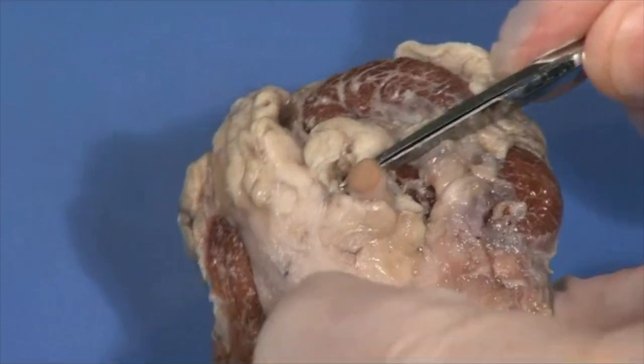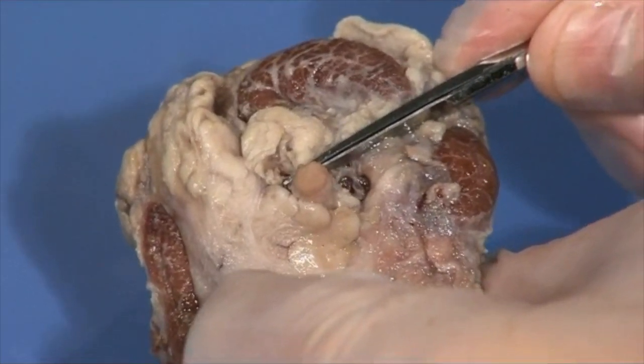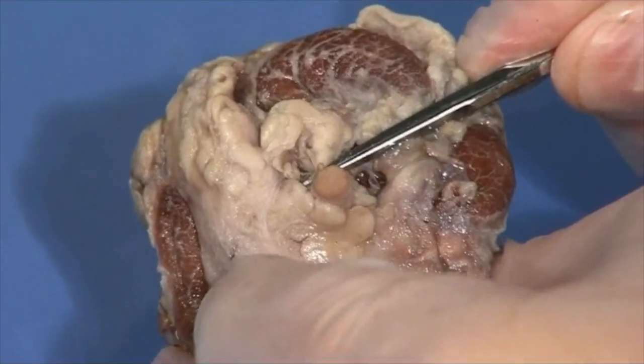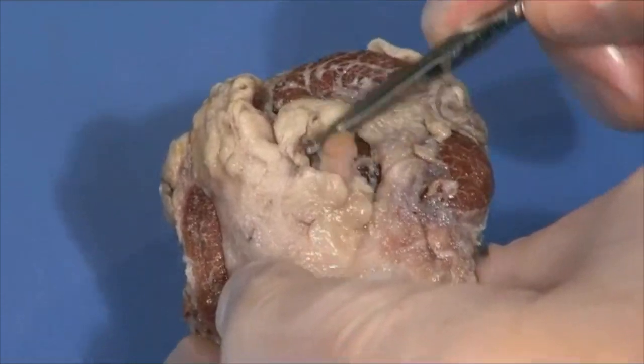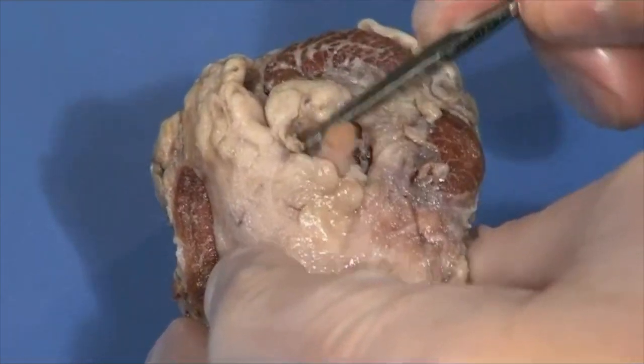Anything else to look for on the outside? Well, coming out the very back, you'll see this little stub that looks like a cord, and that's the optic nerve, which carries the signals from the eye to the brain to be interpreted. That's the only structure on the outside here we don't want to damage. We want to cut around that as we go. As far as starting the dissection, where do you suggest starting?